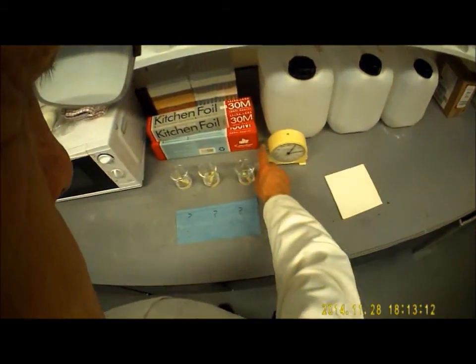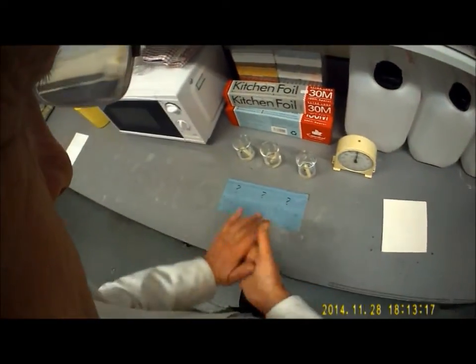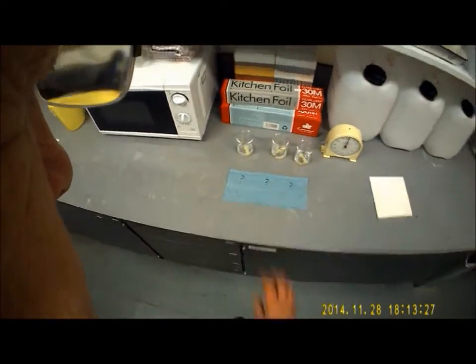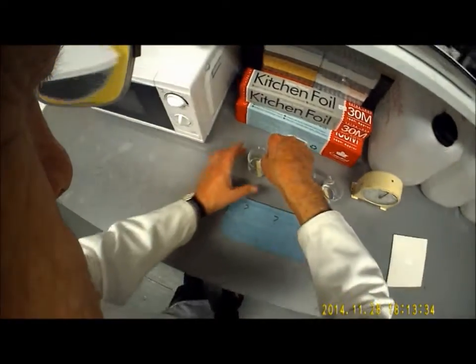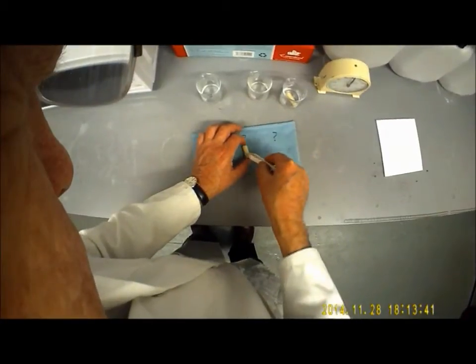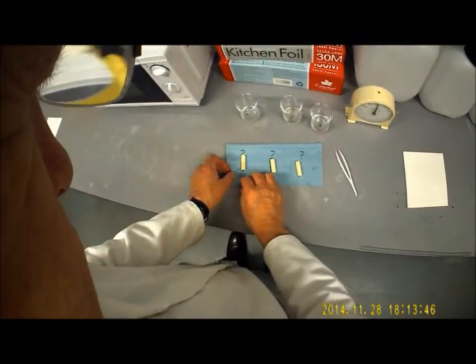Okay, so we're just up to just over 5 minutes now. So I'll reset the clock. I'm going to take the 3 potato cores out. I've actually changed the order around, and you'll notice that I've mixed up the solutions now, just so that you have to actually do it for yourselves. So I'm going to take out the potato cores, like so. 3. So these are in an order which only I know about.